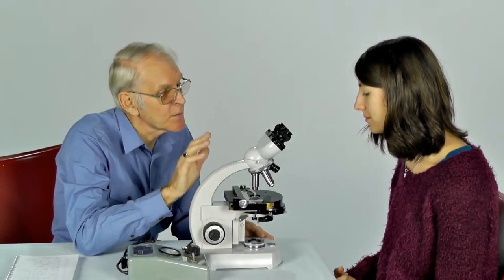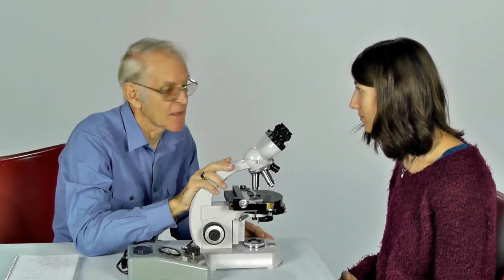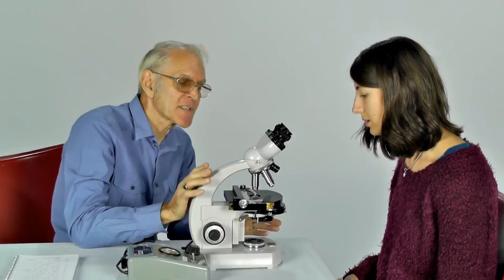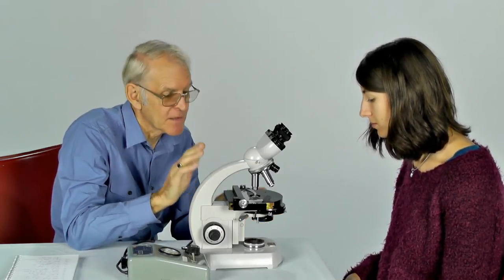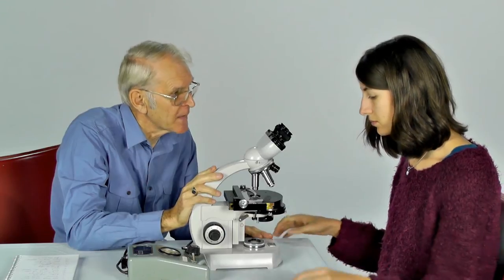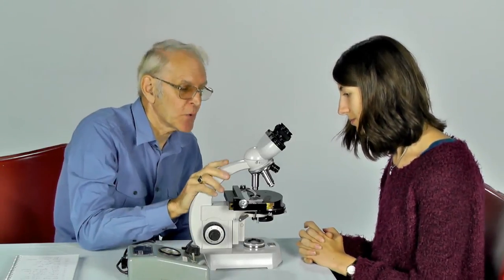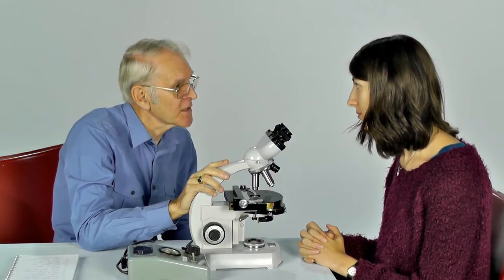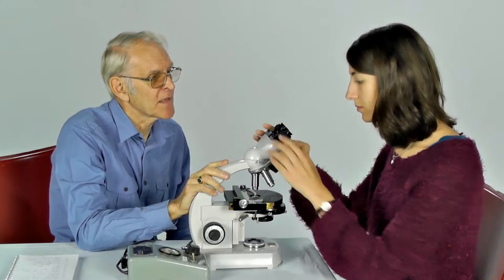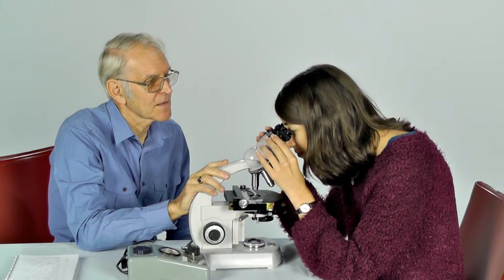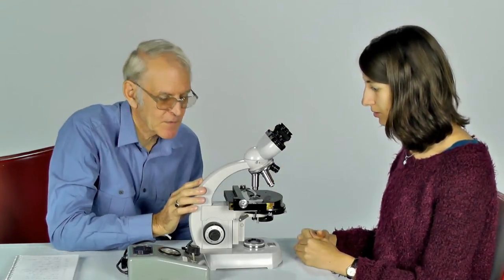Louise, we're going to set up a microscope for normal viewing of a specimen. The first essential is to ensure that your instrument is placed on a firm, solid base, which it is. The second important consideration is whether you're going to be sitting comfortably to use the instrument. So if you look through the eyepieces, can you do that without any particular discomfort? Yeah, that's comfortable. Good.